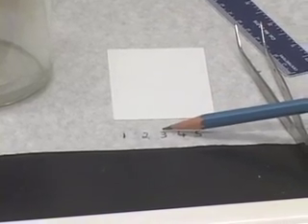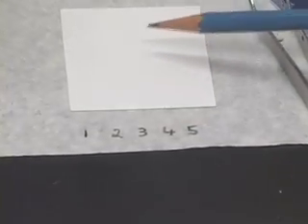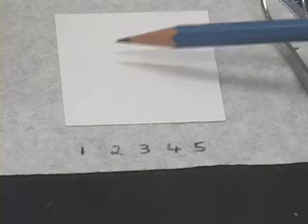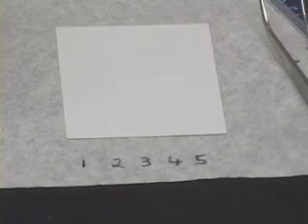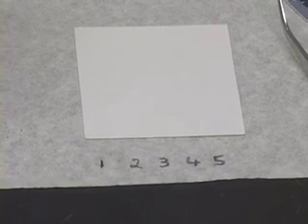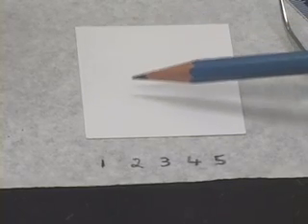Similarly, spots 3 and 4 should give you only one spot. However, these spots may be at different portions along the plate, or in other words different RF values. You all know what RF values mean. The spots may have moved further or nearer depending on the polarities of the compound.